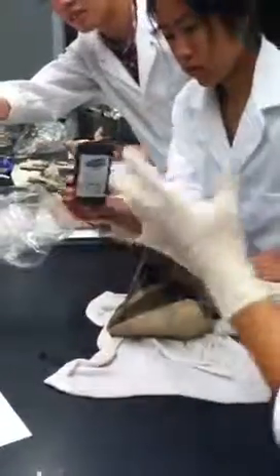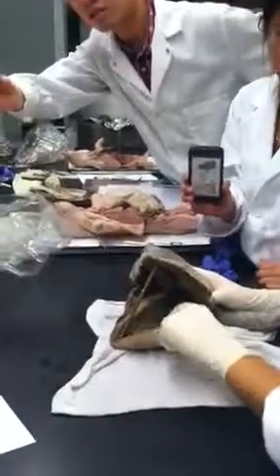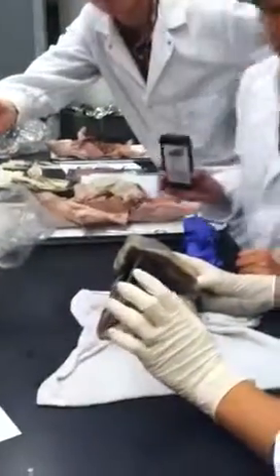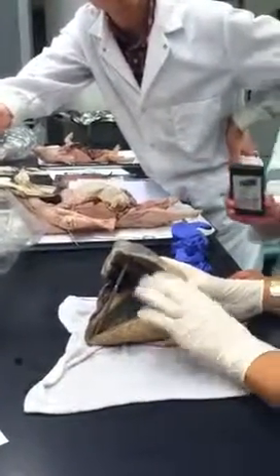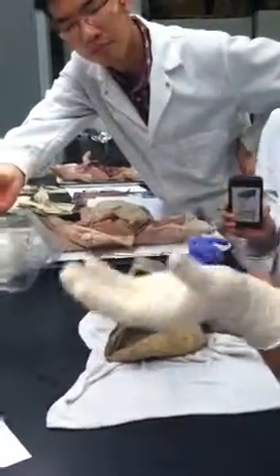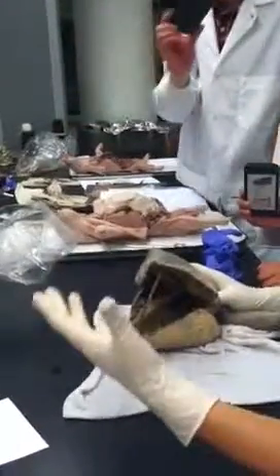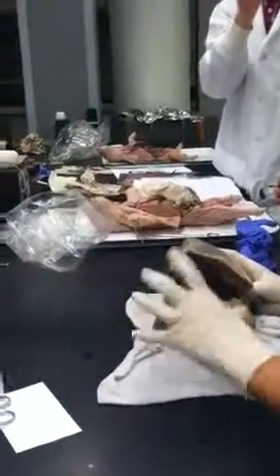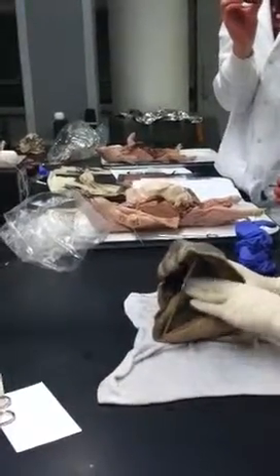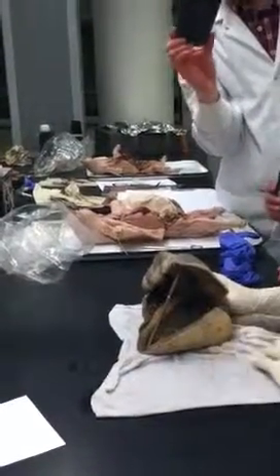So now you're looking at it and you're like, crap, which one's left and which one's right? Here's a really good trick. This is a super meaty wall. And this is a really meaty wall, and then this wall is not very meaty, right? The meaty walls are surrounding the left ventricle. This makes sense kind of intuitively because when the right ventricle pumps, it only needs to pump hard enough to get to the lungs. But when the left ventricle pumps, it needs to pump so hard that it can get blood all the way to the big toe. So just by fluid dynamics, it makes sense that the left ventricle is really huge and really strong. So when you guys see this, see meat, think left. Which is confusing because right now it's on the right side.